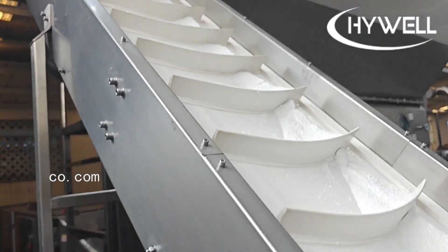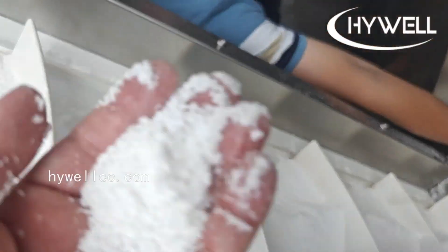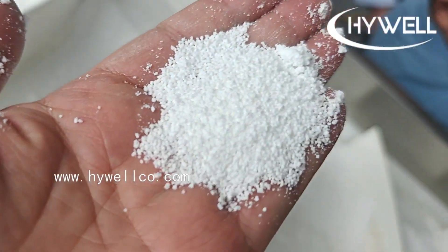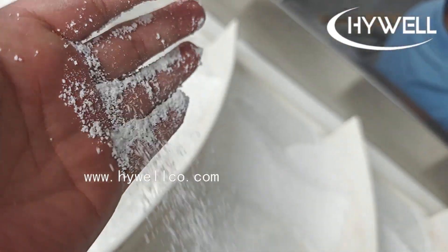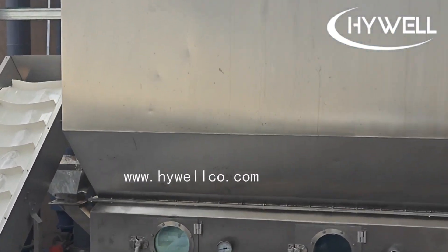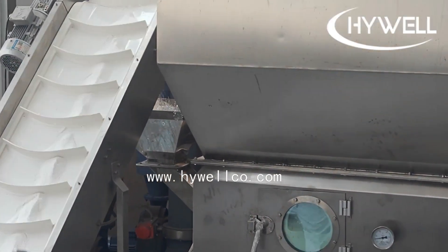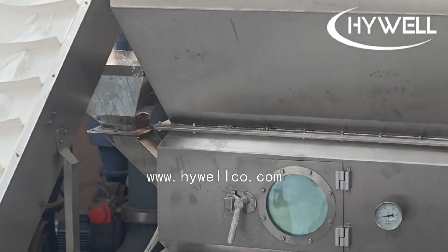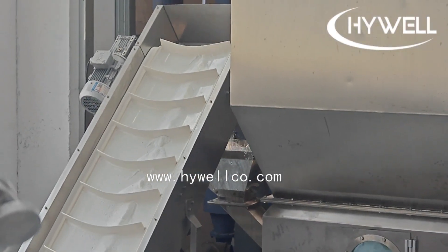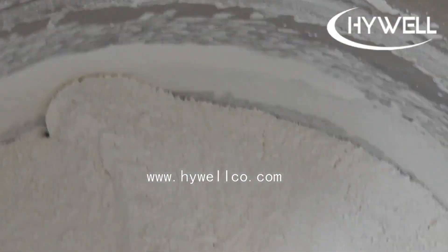The drying process is divided into several stages. The first batch of materials enters the first section for pre-drying. The pre-dried materials are transferred to the second section for re-drying. The materials dried in the second section enter the third section for cooling. During this process, new wet materials are continuously fed into the fluidized bed dryer for cyclic drying to achieve batch discharge. The dried materials are discharged through the fluidized bed and then enter the vibrating screener for screening.